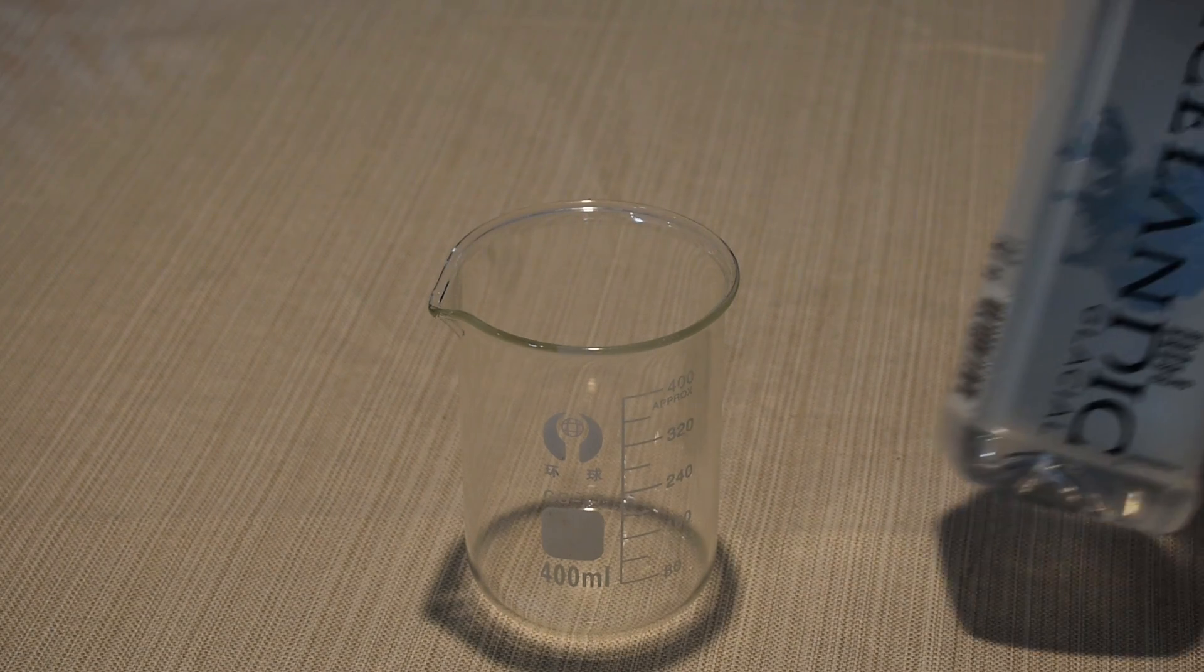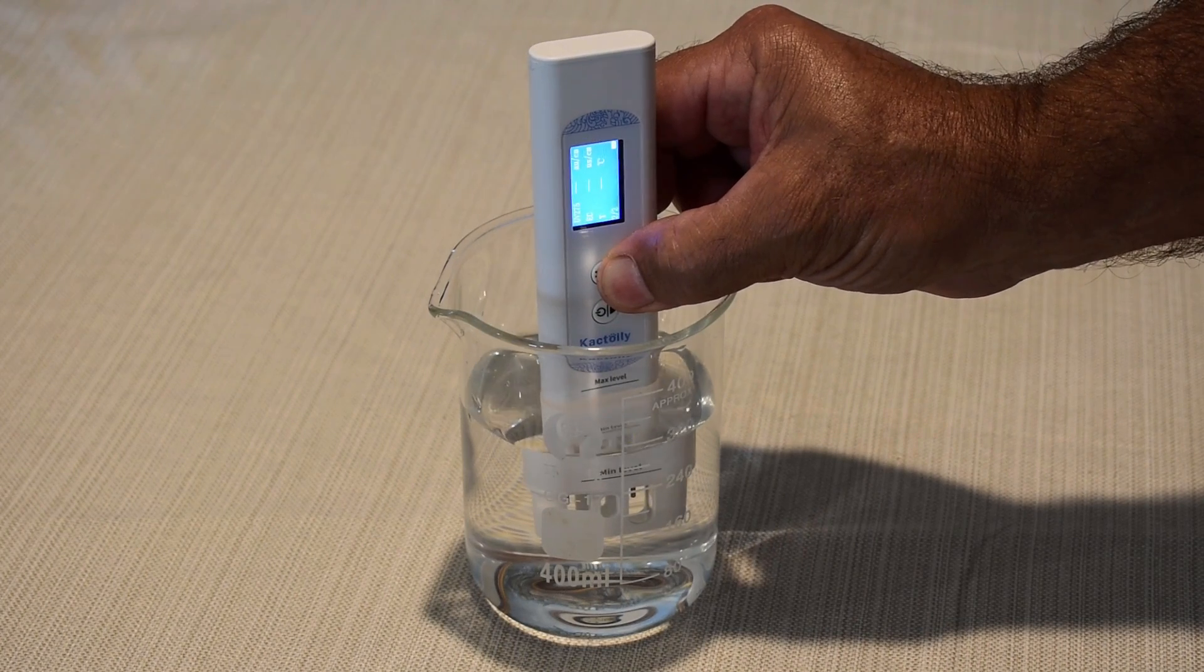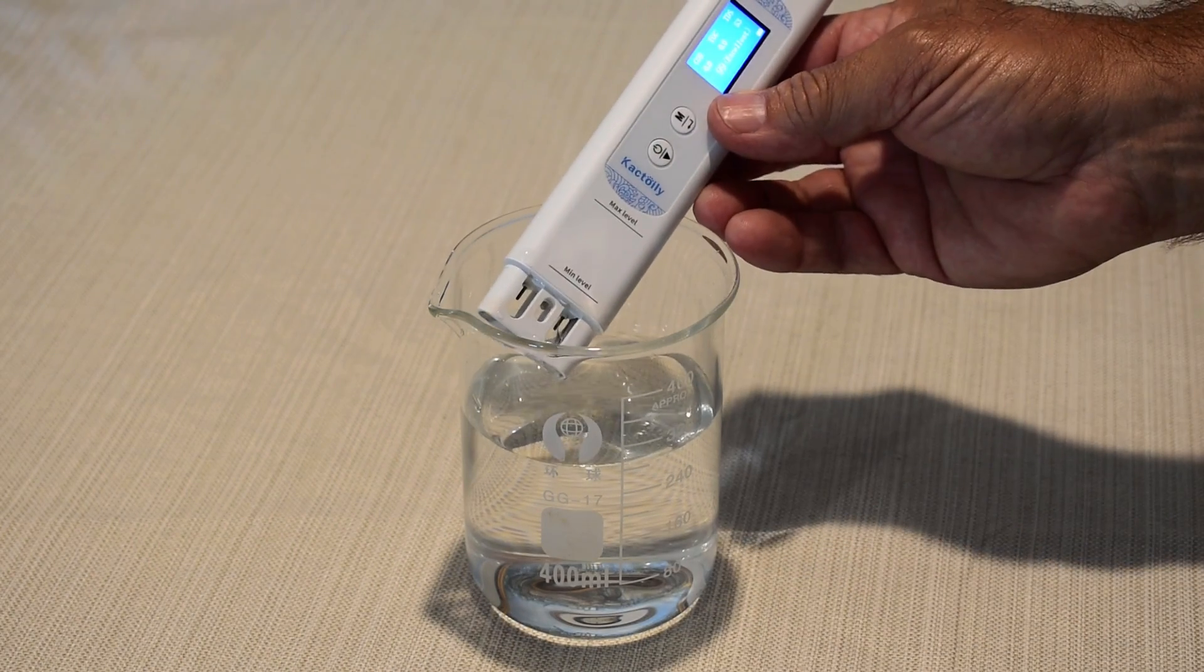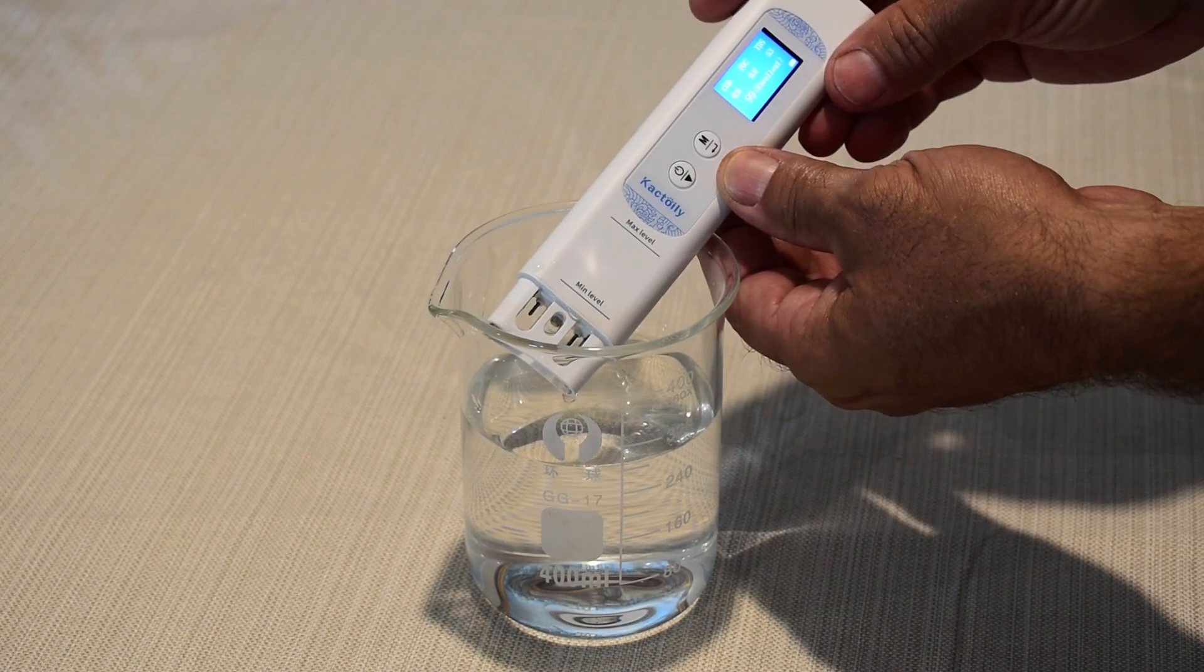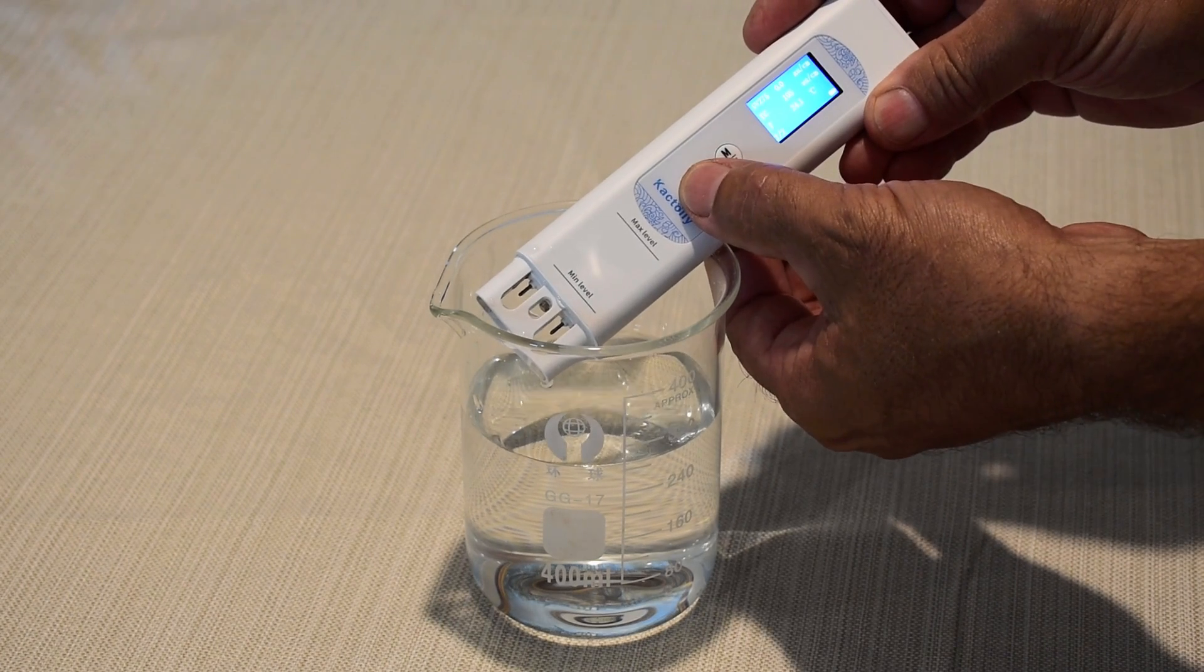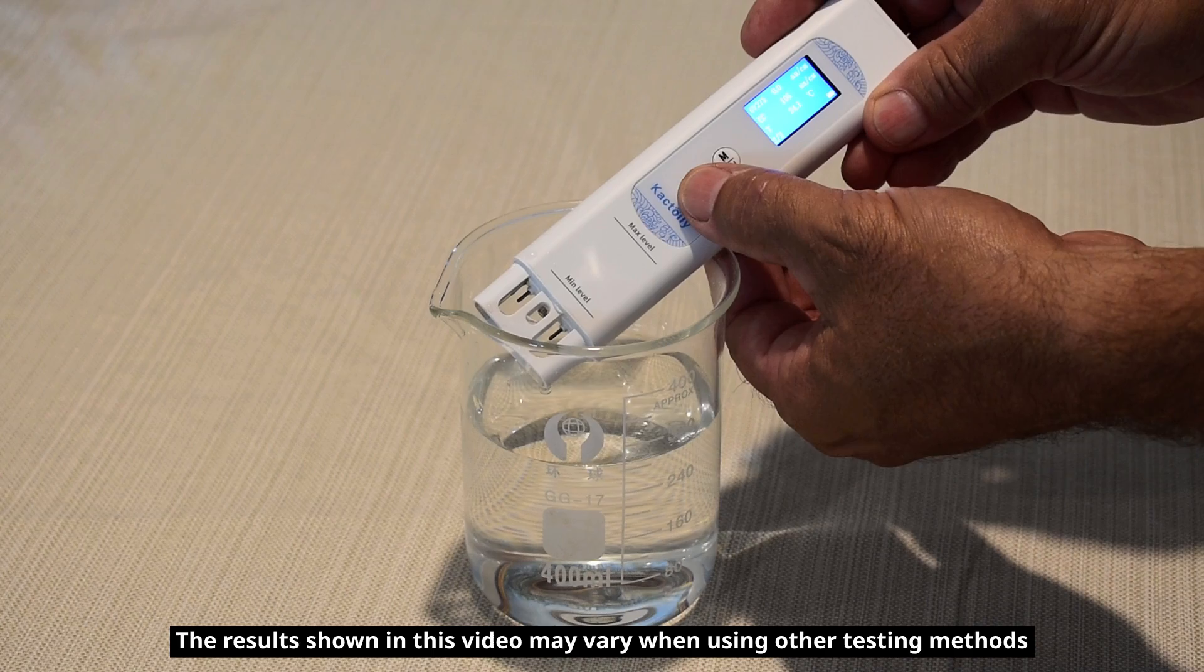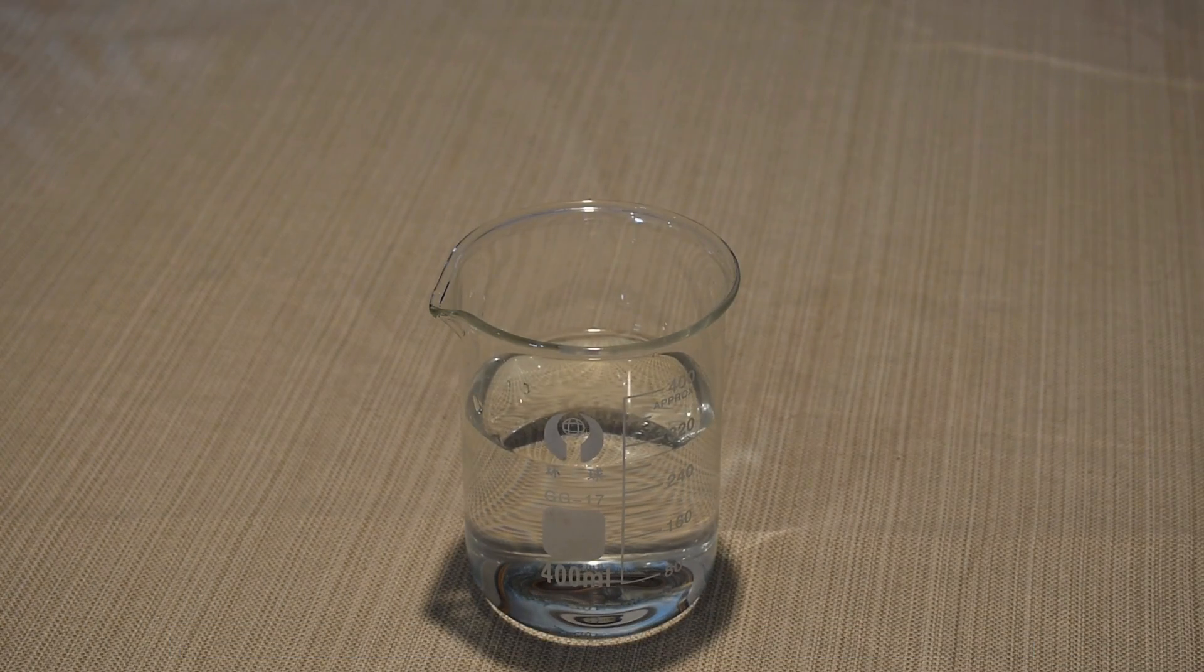The next one we're going to be testing is Icelandic. Okay, let's push this here and see what it is. 99, excellent. COD, TOC is zero, TDS of 53. Zero on the UV-275, electrical conductivity 105. So far, each brand is looking pretty good.